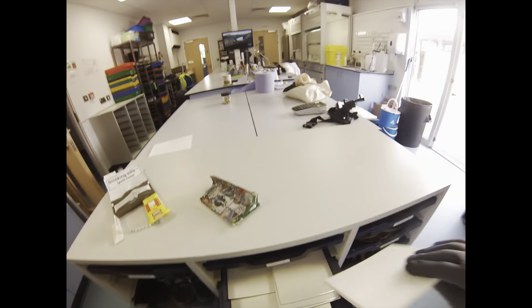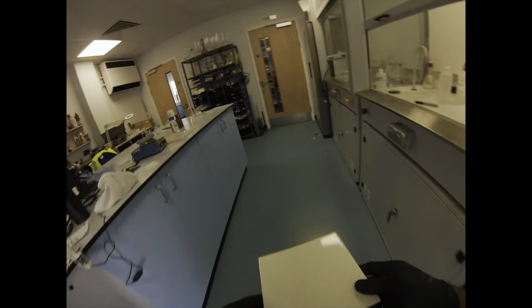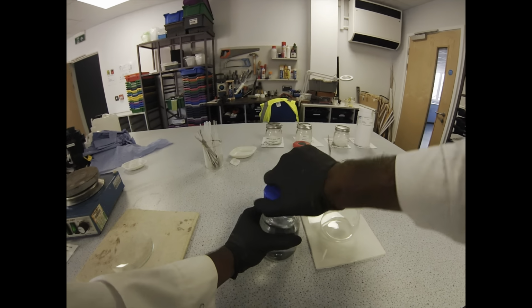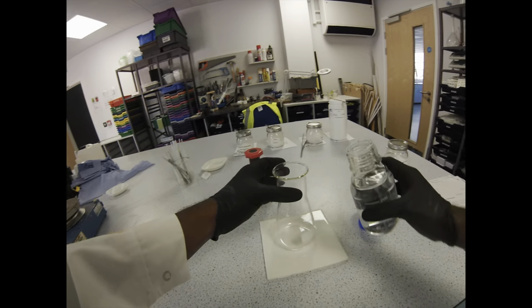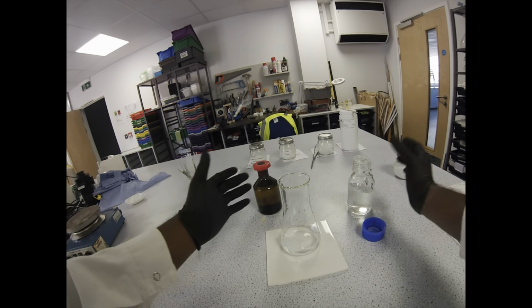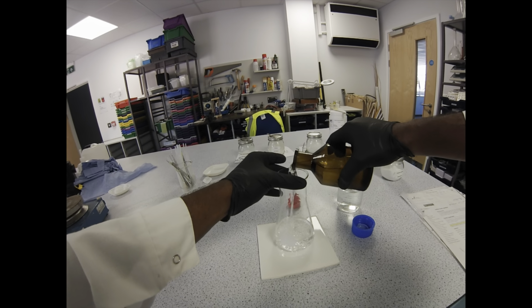Chemistry doesn't always have to be crash, bang, whiz to be thought-provoking. When you're setting up the demonstration, you're going to want a white tile or some white surface just to give it that nice contrast. Obviously, that's a must for any colour change reaction when you're demonstrating. I've also seen people put it on a stirrer. I've also seen people decant it from flask to flask until it changes mid-pour. That doesn't always happen, but sometimes you can get it to change as you're pouring it, which is quite a nice variation on that.